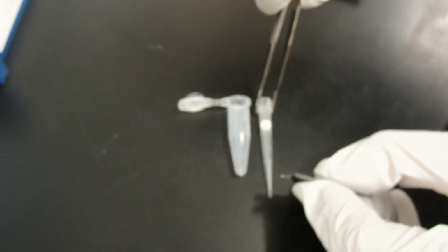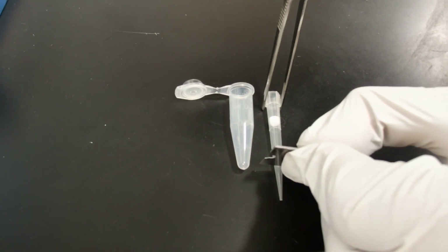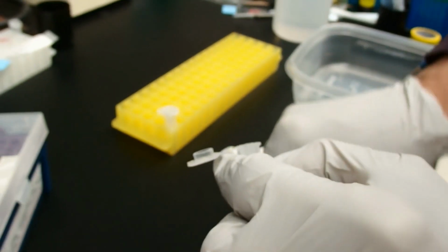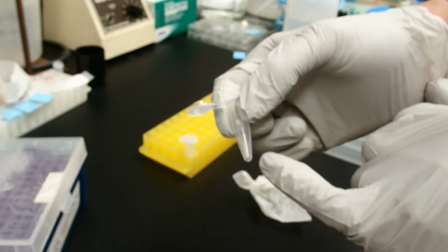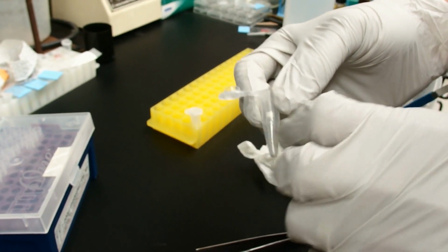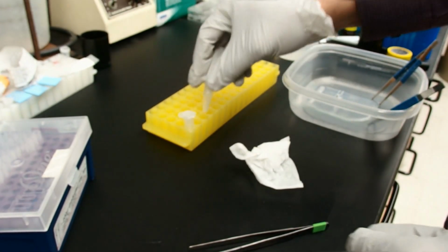Same thing for the 200 microliter tip. We need to cut this so that it can fit in here. The reason we'll get a little bit less yield with this is that you'll often have some droplet in the bottom of this filter tip at the end that is hard to get out. So it's desirable to use the small one if you can.